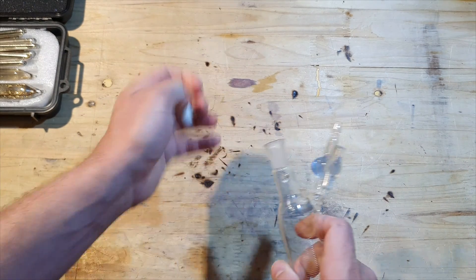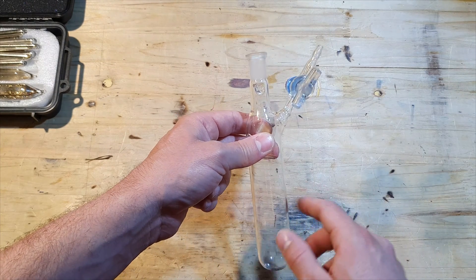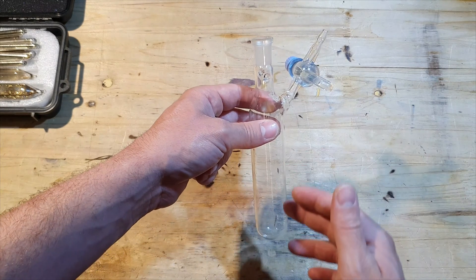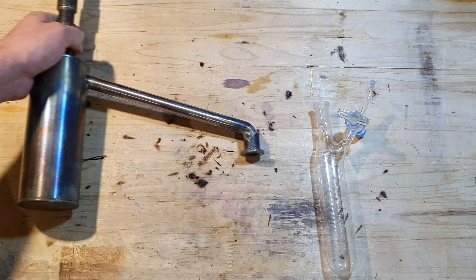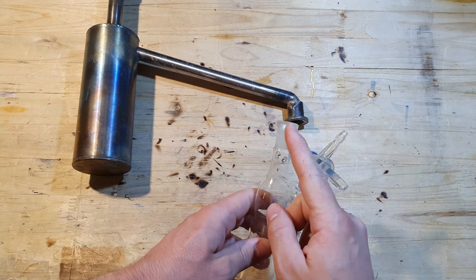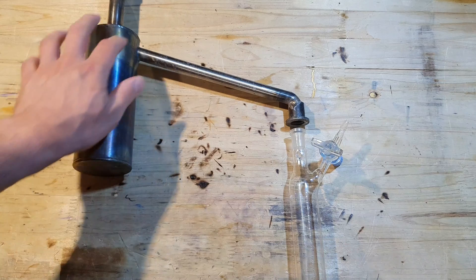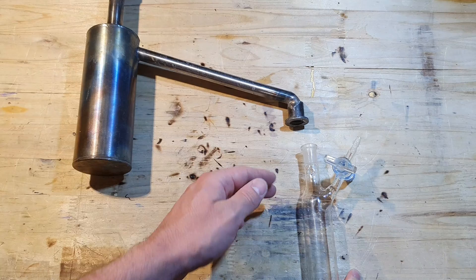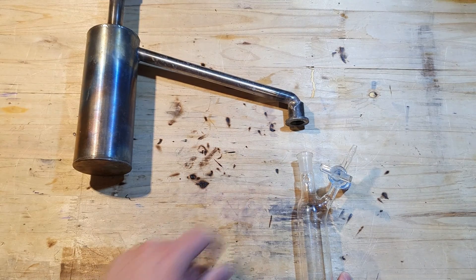What I'm going to do is distill the cesium in here, use a glass stopper to seal it, fill it with argon, and afterwards we can fill it with mineral oil and take out the certain amount of cesium we'll need for a smaller scale experiment. But as you can see, the connection on the top here is an NS14 glass ground joint, and I'm not going to be able to connect it to my reaction vessel because this is a KF flange. So the first thing I have to do is make a connector to connect this KF flange to this NS14 glass ground joint.